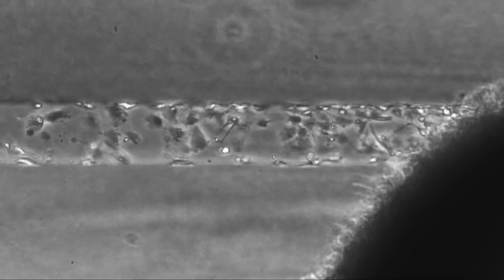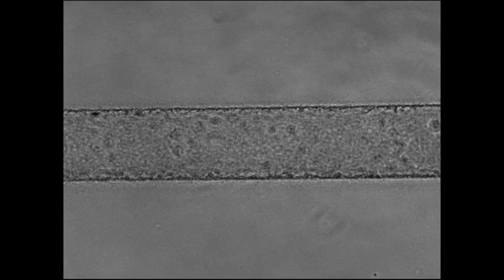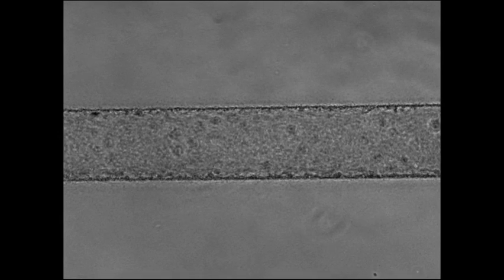Since we can control the distance between the blood vessel that I make and the cancer cells, we can get a better idea of when the cancer will invade into the blood vessels. That gives us much more predictive ability of when the key events happen. We can also see how molecules are diffusing through the blood vessel and into the surrounding tissue and into the cancer cells.